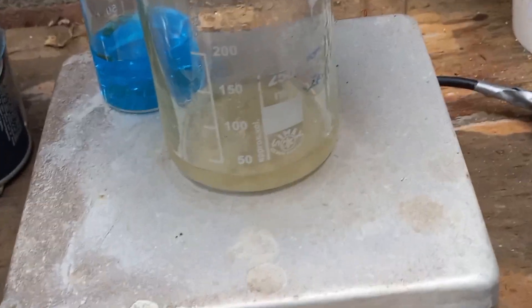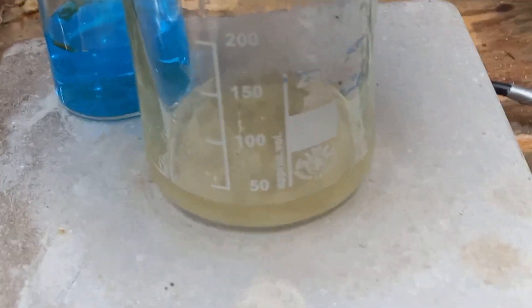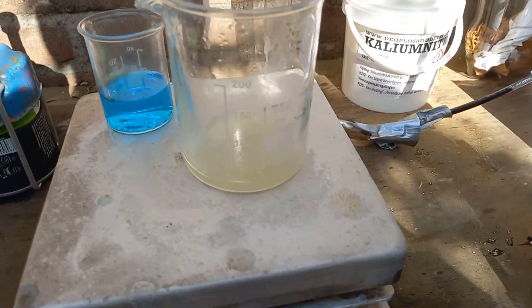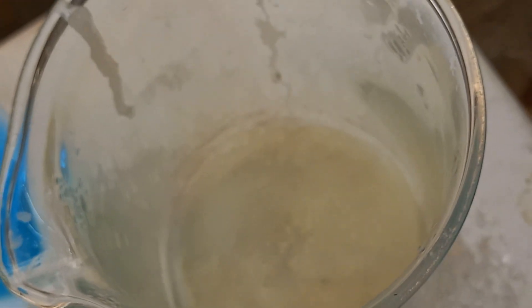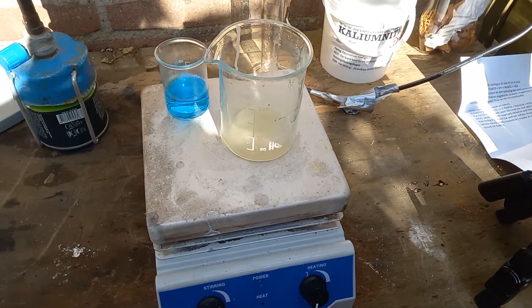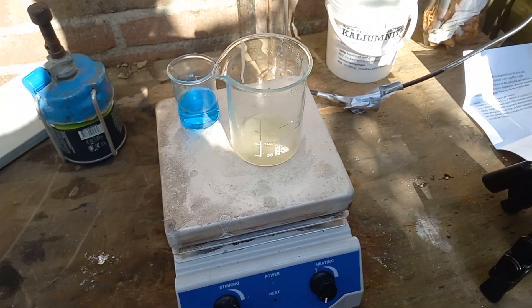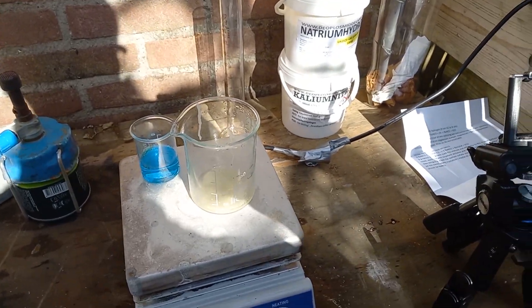Of course it decides to be all aggressive — like why not? But there's actually a precipitate forming. Okay, so quite a bit of precipitate formed, as you can see. I'm just going to filter it. Hopefully we have some sodium nitrite of reasonable quality — decent and reasonable.